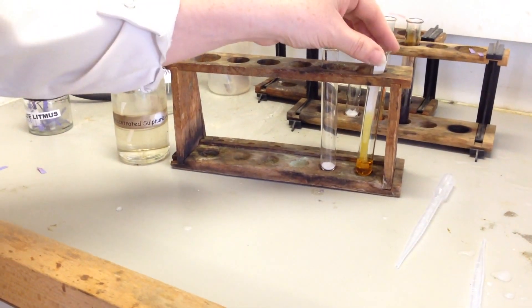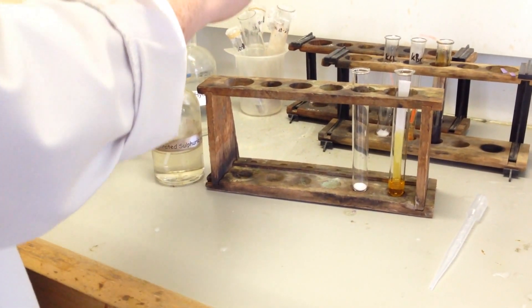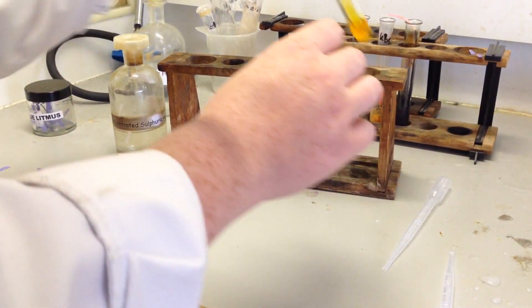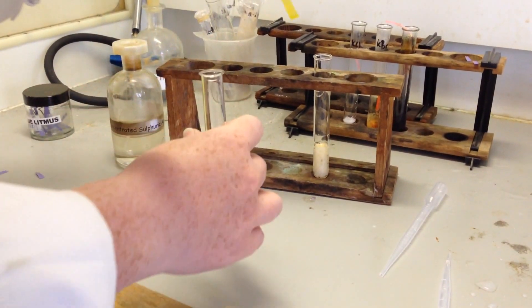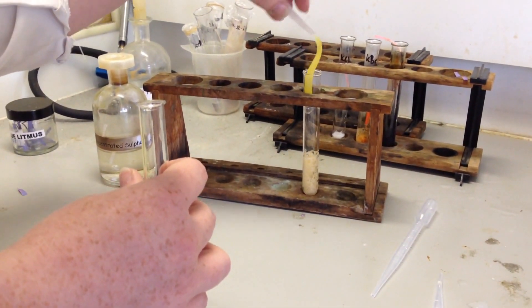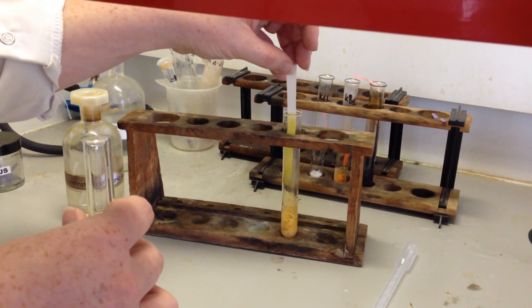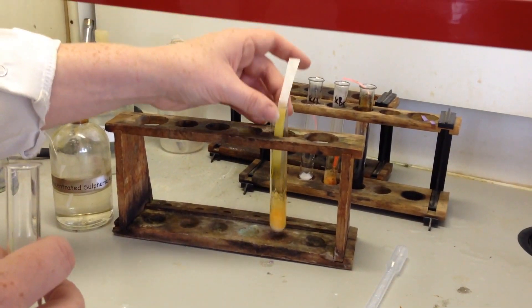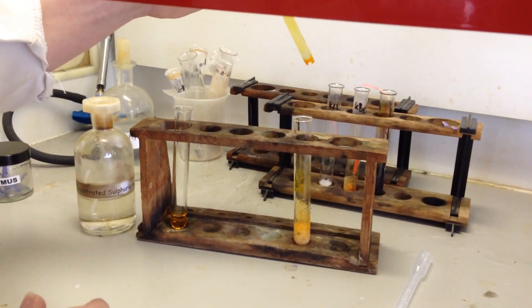So here we have some potassium bromide and some filter paper that has been soaked in acidified dichromate solution. I'm going to again add just a few drops of concentrated sulfuric acid to it, and then add in the filter paper soaked in dichromate solution. You can see this is bubbling around because there is quite a lot of gas coming off. And you can see the filter paper is turning a dark orange colour.